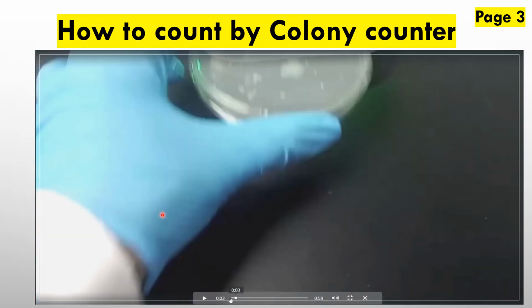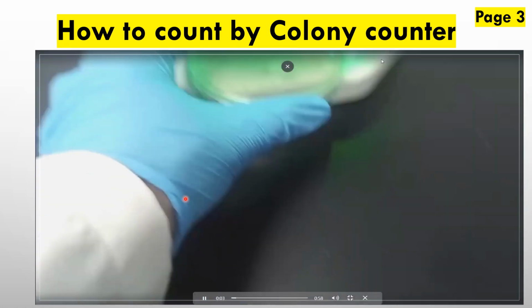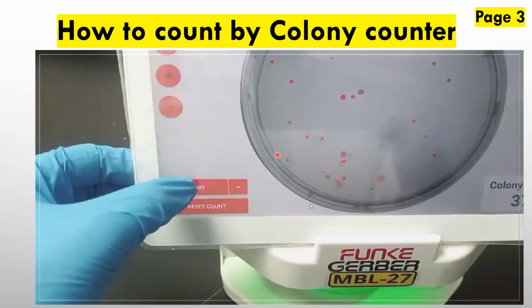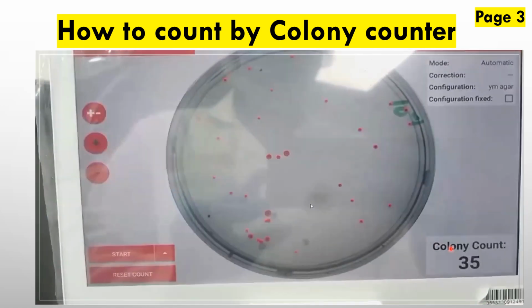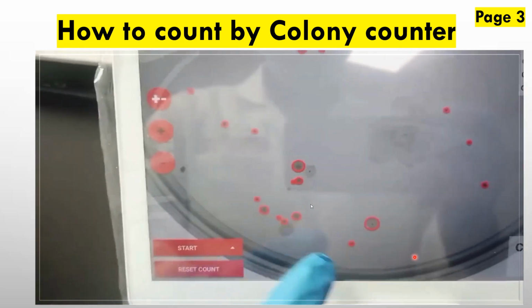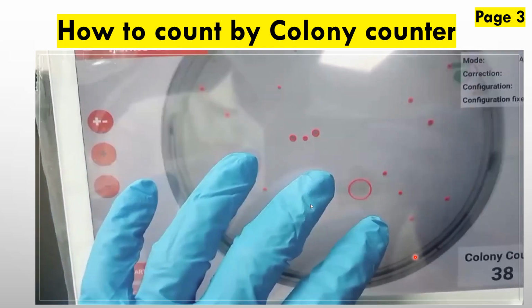This is a colony counter. Suppose there is a plate, and this is the plate we want to count. We place it in the colony counter. We will simply press the start button and it gives the count. This is the automatic process of a colony counter. If any colony is skipped, we can also add it manually. They also give this option.